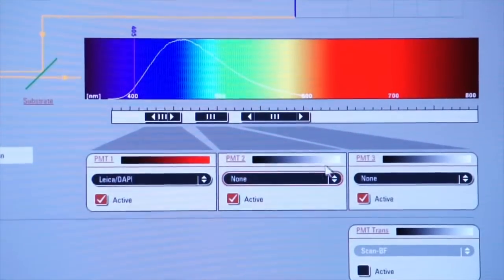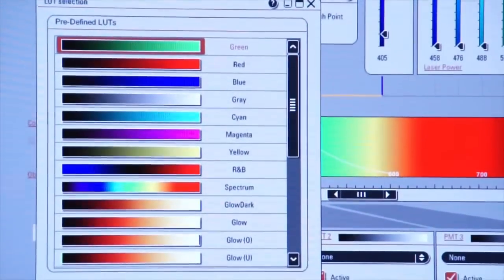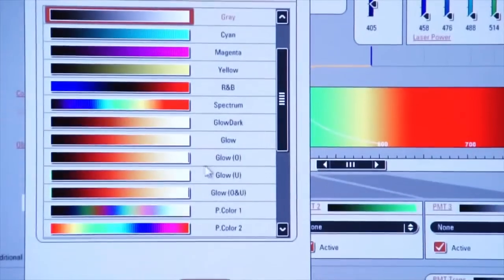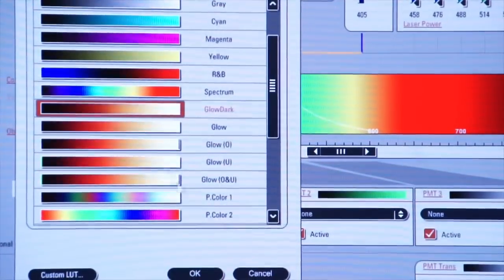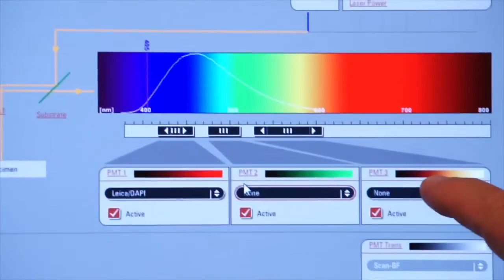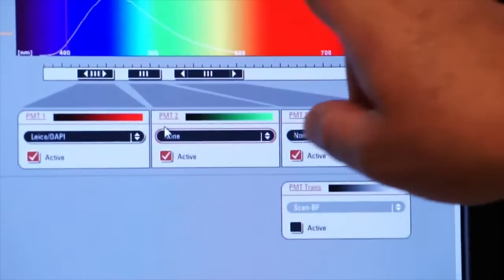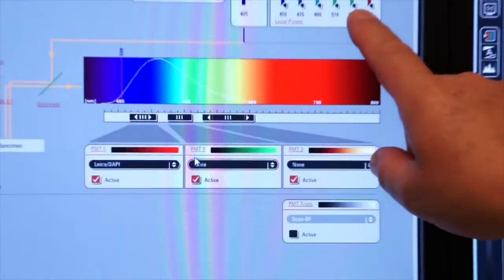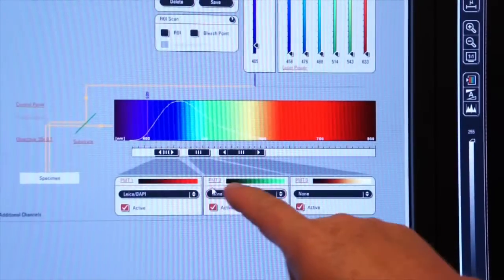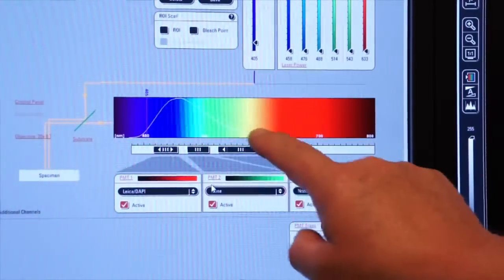Let's make this one green. And let's make this one maybe a glow dark. And so now I have 3 different colors selected for my PMT. So not only can I select different laser lines, I can select one or more of the PMTs, and I can select the output color of each PMT so that I know, even within one emission spectra, what colors I'm looking at in the spectrum.